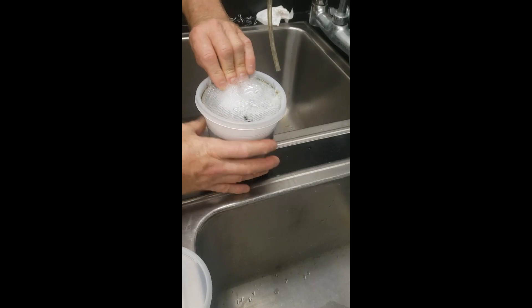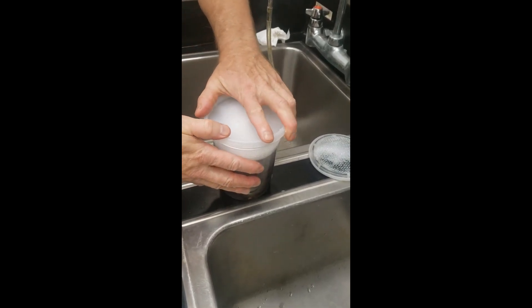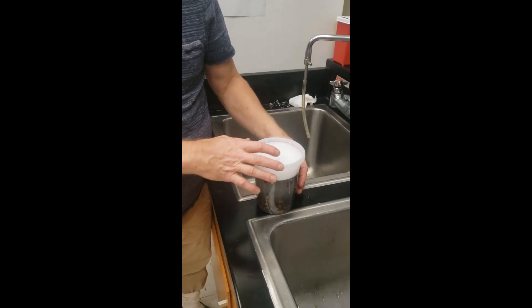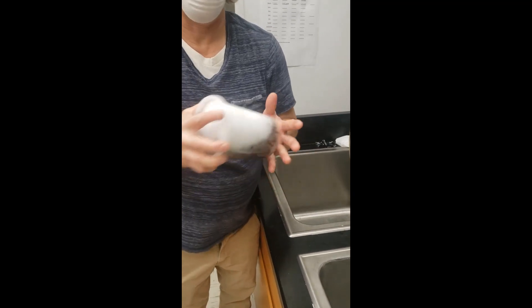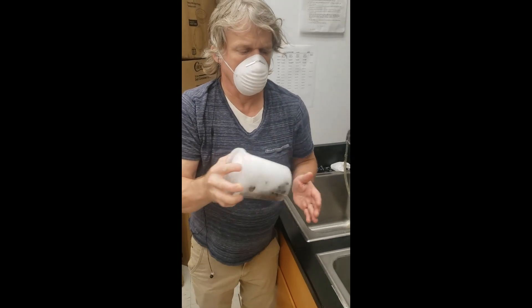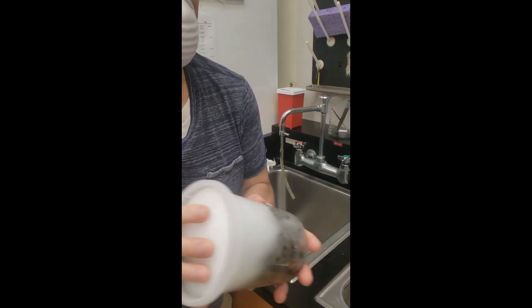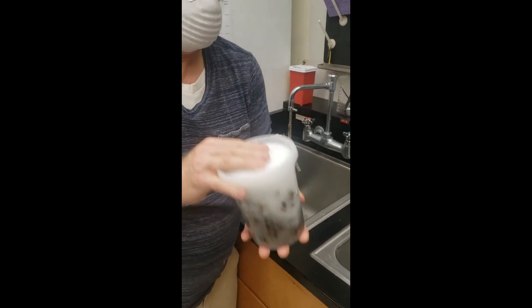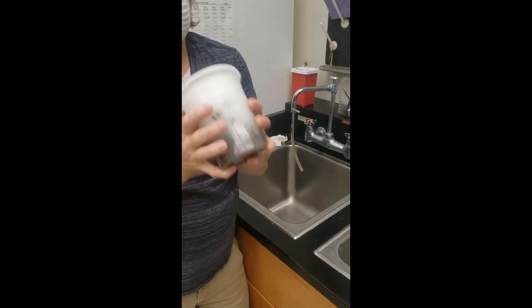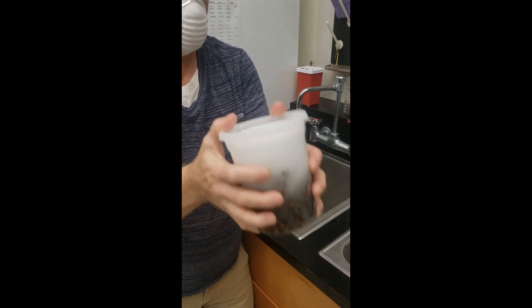Remove the screen lid and add the regular lid. Now that the bees are submerged, we're going to wash them — Dave will shake for 25-30 seconds. Shake it vigorously. There's no wrong way here. Dave's going horizontal, which is probably good; you could go vertical. We need about 30 seconds total of shaking.